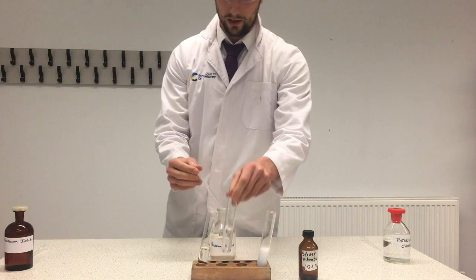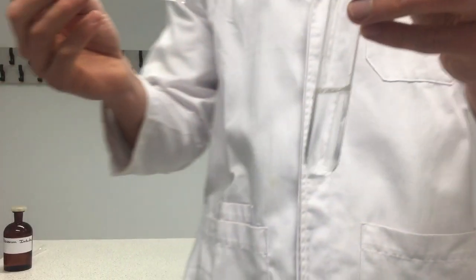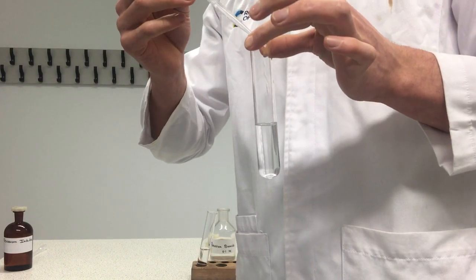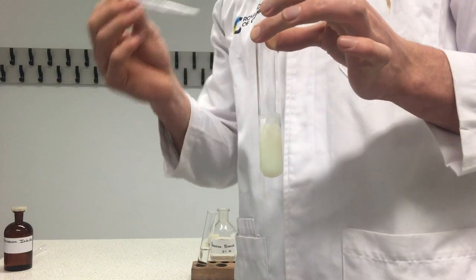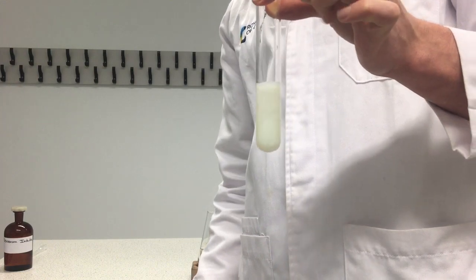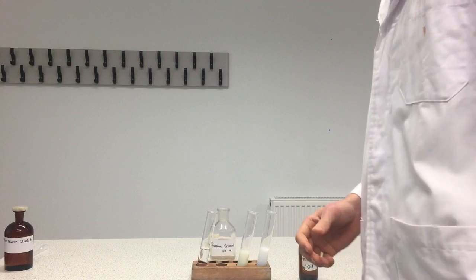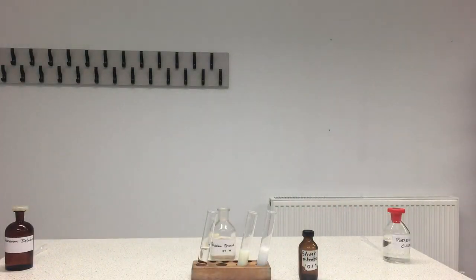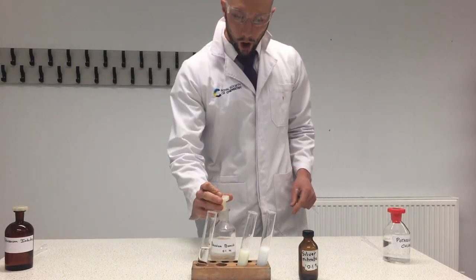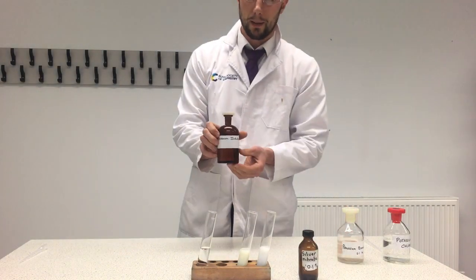This one is potassium bromide. We're going to see a similar thing, but the color should be slightly different. Let's add some potassium bromide in — again it looks milky or cloudy, but if we compare, the color is clearly different. Potassium chloride was white; potassium bromide is cream.